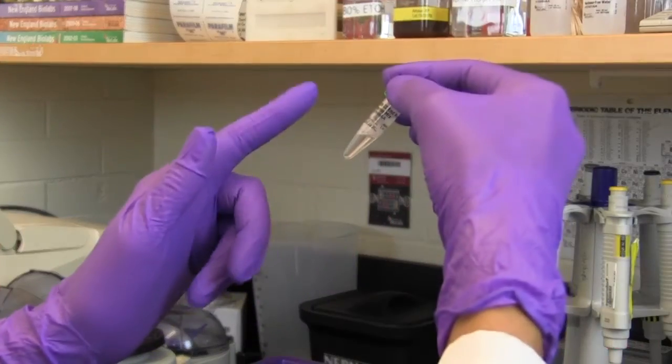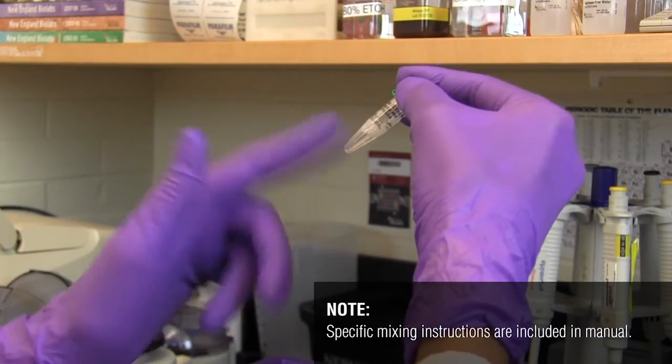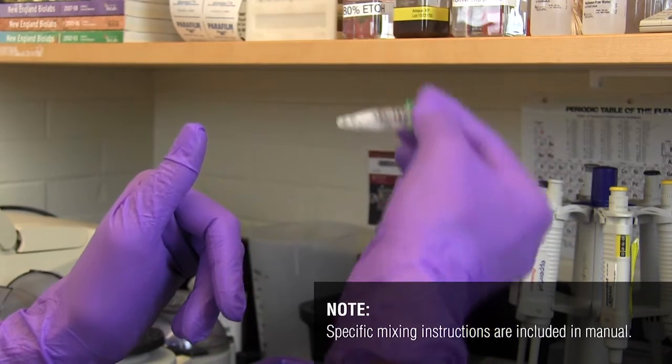When working with the reagents included in the kit, it's important to ensure that they are well mixed before use.